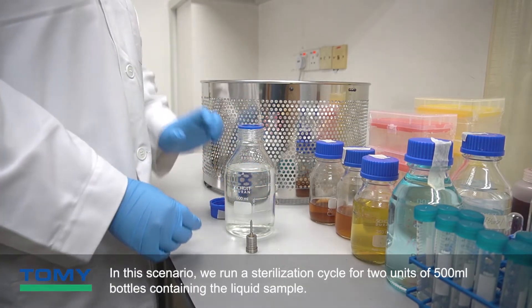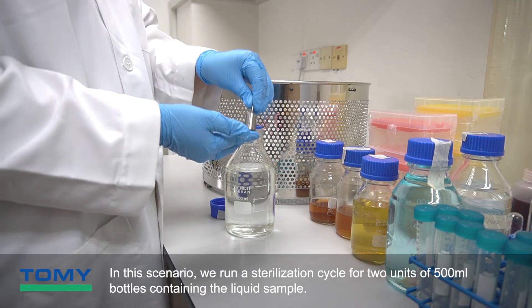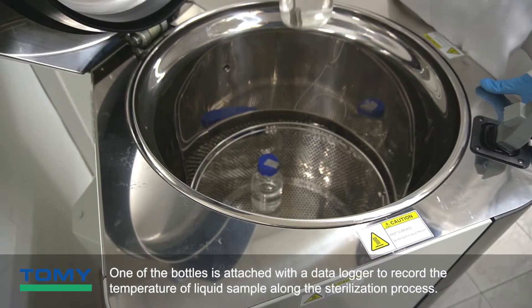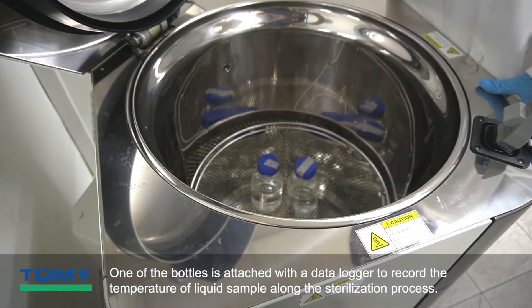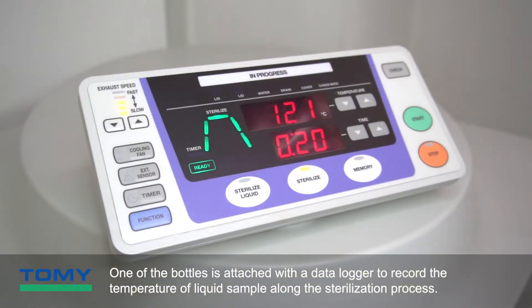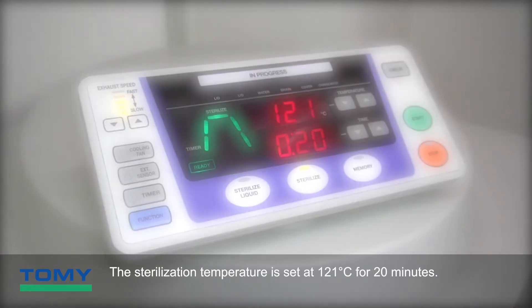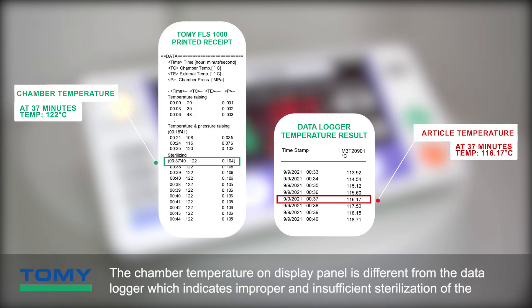In this scenario, we run a sterilization cycle for 2 units of 500 milliliter bottles containing a liquid sample. One of the bottles is attached with a data logger to record the temperature of the liquid sample throughout the sterilization process. The sterilization temperature is set at 121 degrees Celsius for 20 minutes.